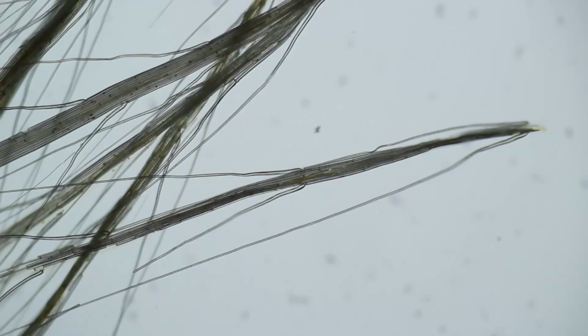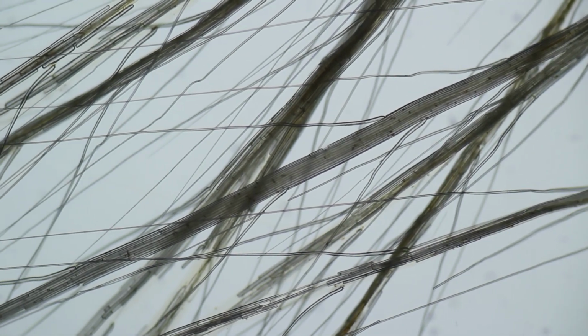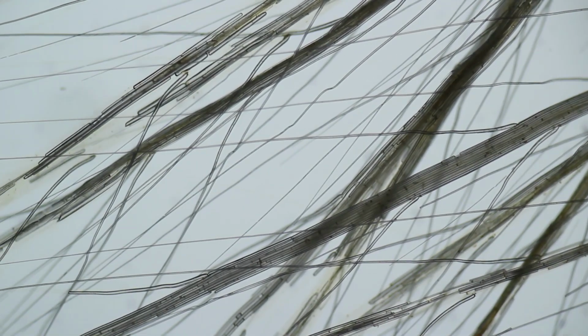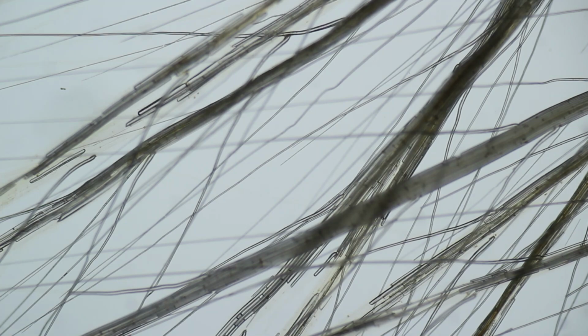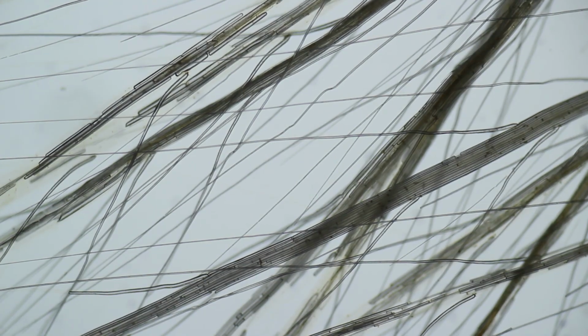Yeah, I think I just also wanted to show you now some of the pictures that I have taken using the system. Yeah, and as you can see, I'm kind of satisfied. This here is a thistle, which is a plant. There are some plant fibers. Some time ago I made a permanent mount, which I just wanted to show you. So the sample specimen is rather arbitrary.